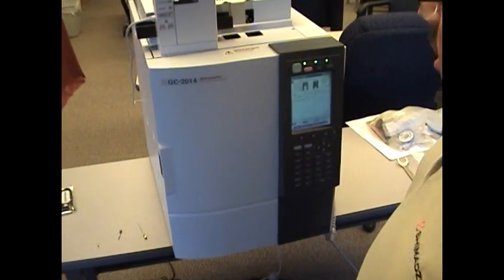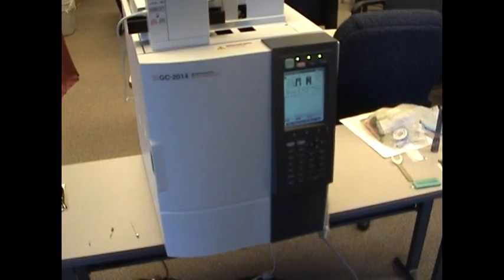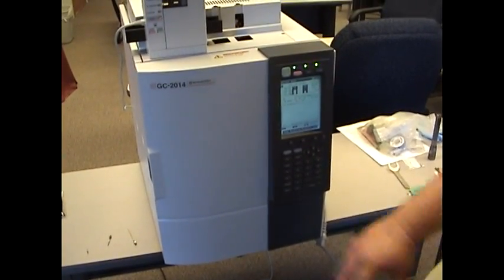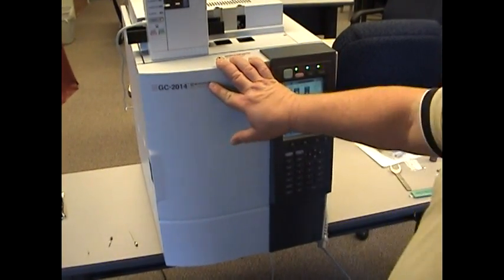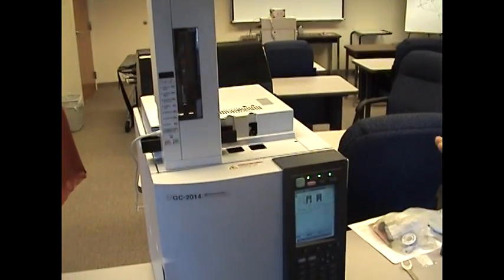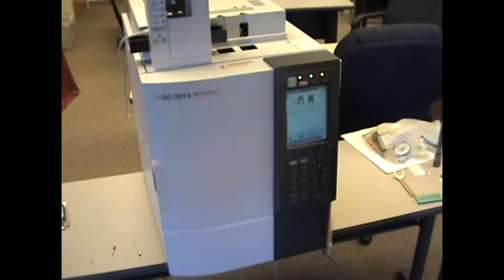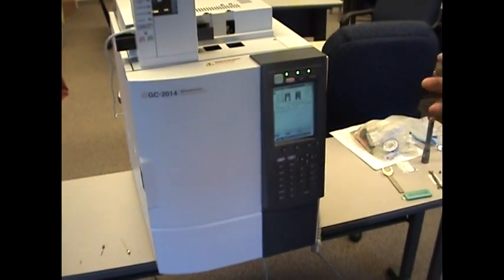Hello, this is another installment for the GC2014 user interaction and training class. This is the GC2014 gas chromatograph with an AOC20I injector. What we're going to cover is changing the SEPTA out and also changing out the glass liner or glass insert.